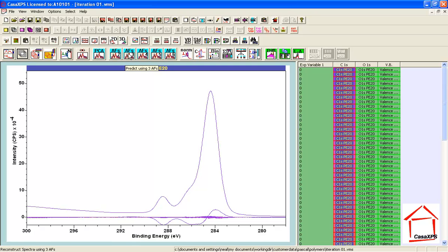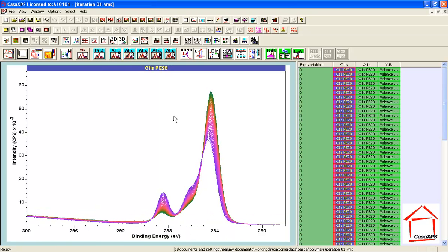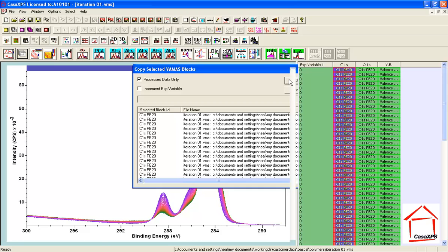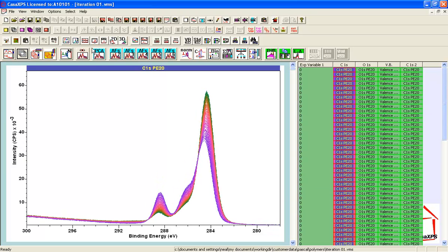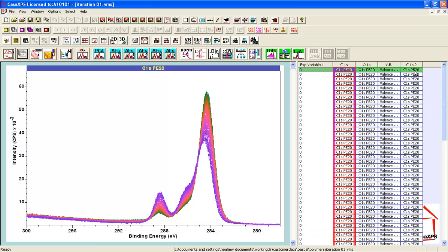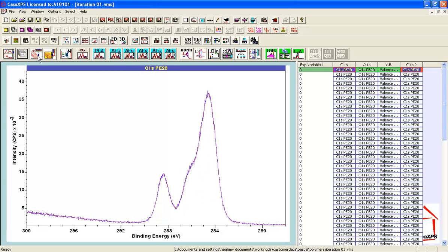Nevertheless, I will calculate a reproduction of the data using 3 abstract factors. This means I'm essentially fitting 3 abstract factors to each spectrum and using that fit as the approximation to the data. So when I press the AF3 button, it then calculates a set of spectra, all now with reduced noise compared to the original data. I'll take a copy of the processed form of these data, and they've been moved to a different column, and that allows me to then overlay and reset the data back to its raw state. And what I'm comparing is the difference between the PCA corrected and the raw data.